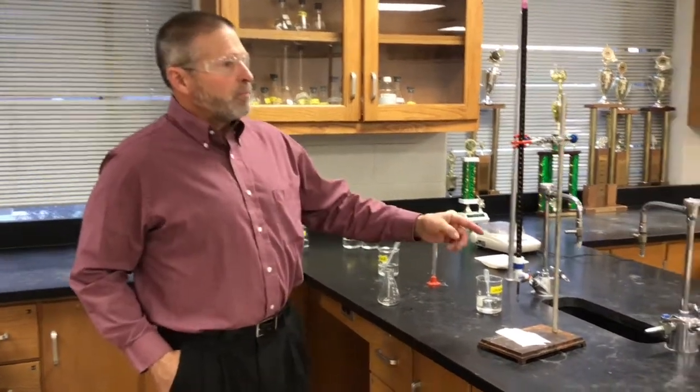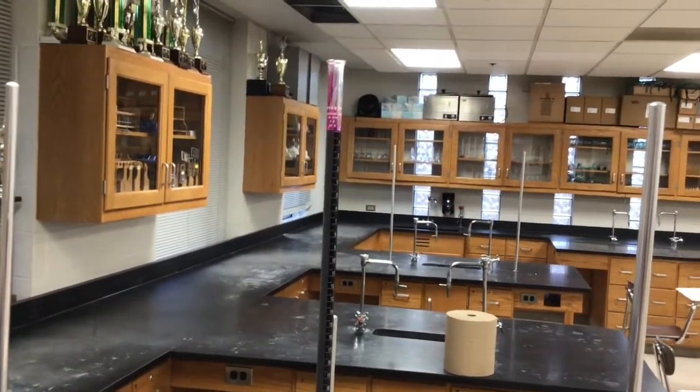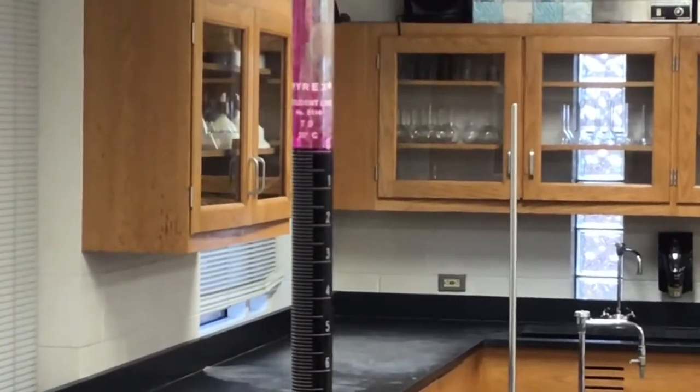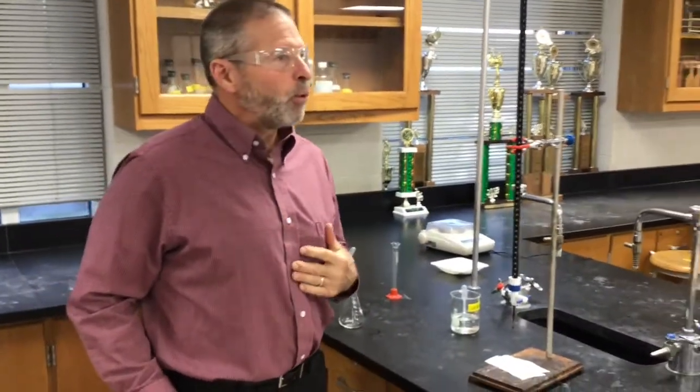So at our lab station. Yep, we're at our lab station. We're going to get ready to titrate here. As we mentioned earlier, the permanganate is in the burette. It's got a really nice, beautiful, deep purple color. Looks like grape juice. But it doesn't taste like grape juice. Concentration, as we mentioned earlier, is 0.150.